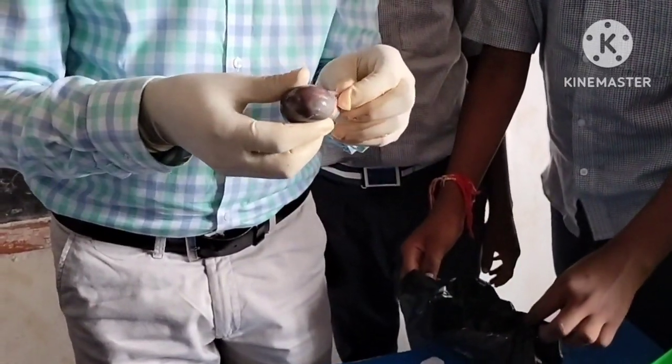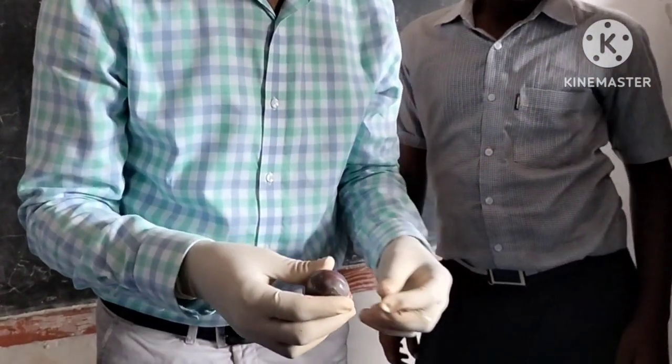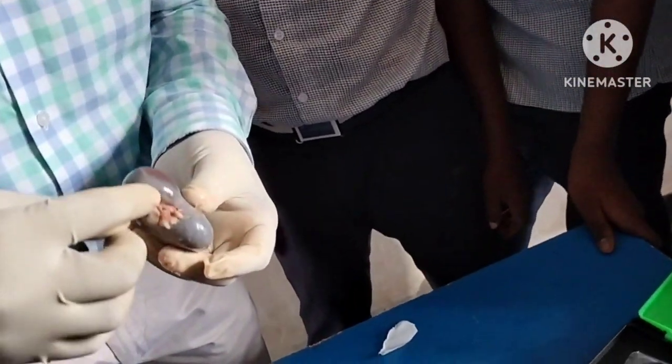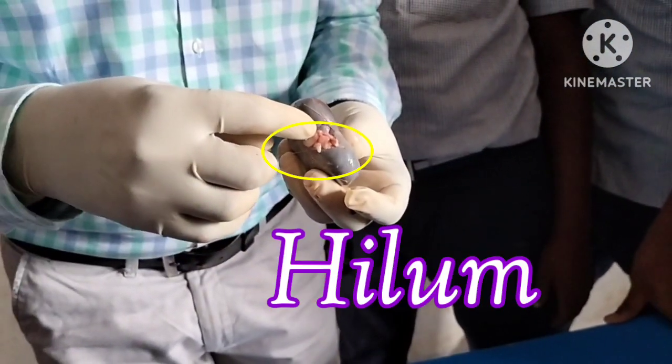Hi friends, look at this. This is a mammalian kidney. So I took a goat's kidney. You can see here the notch called hilum.